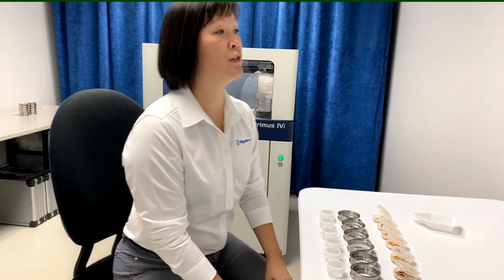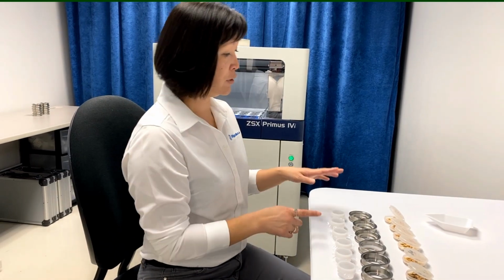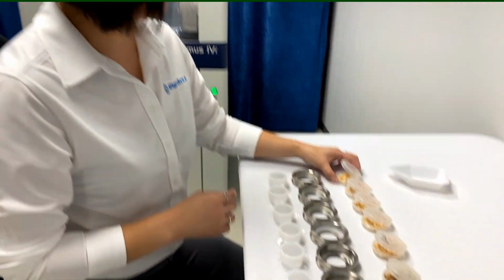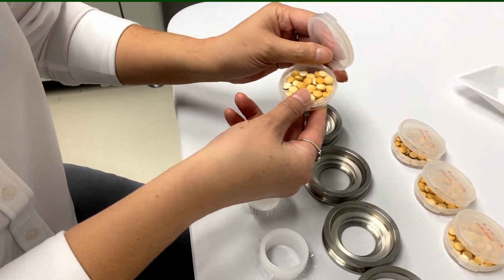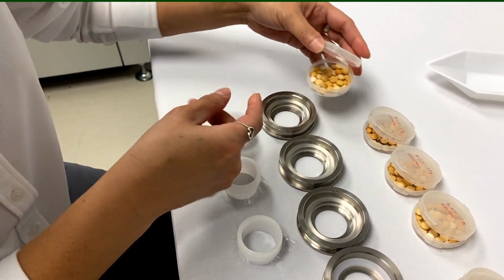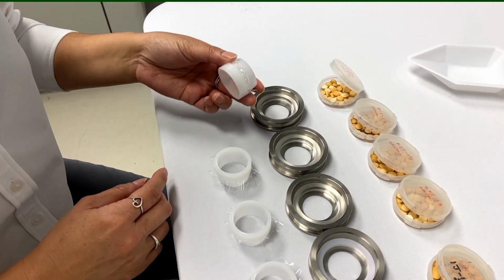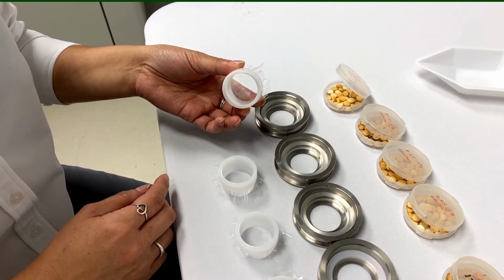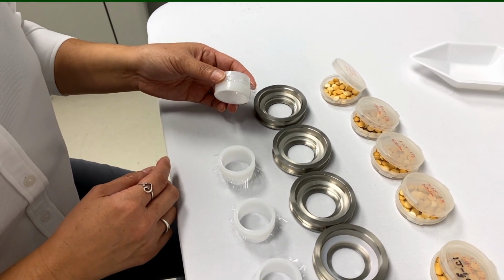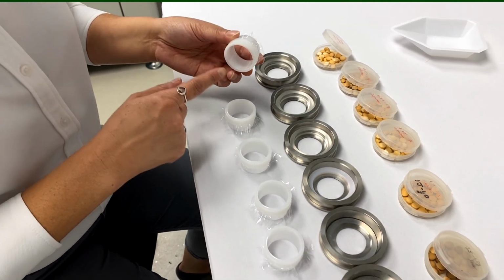Okay, now that we've prepared our samples in the prep lab, we've moved over to our instrument where we'll show you how simple it is to load up the samples and run them. We're showing the easiest prep here, which is just the pills. We made the powder at each of the concentrations, and then pressed them into individual pills so that we would be mimicking the calibration you do. As long as you can calibrate like that, you could just run your samples by pouring them in the way Thanh is going to show you right now with the calibrants.